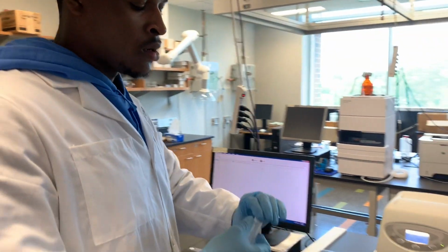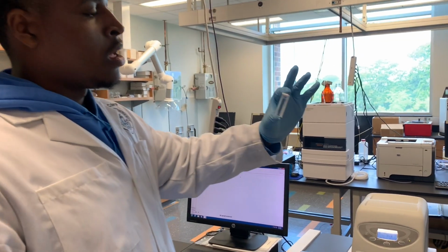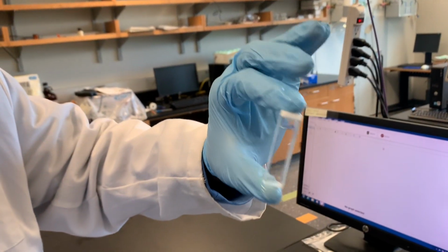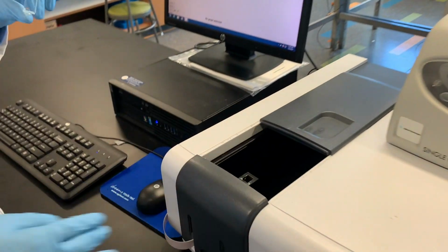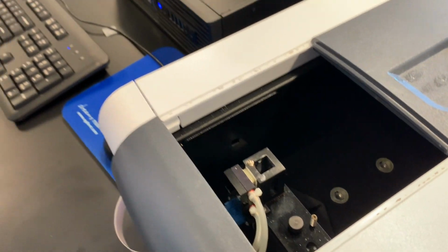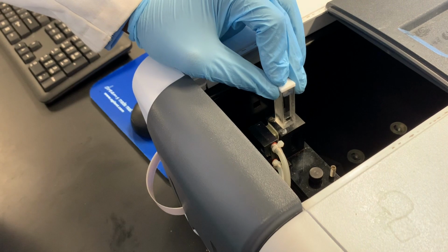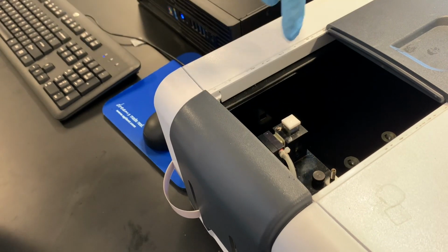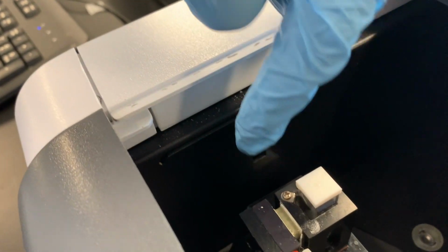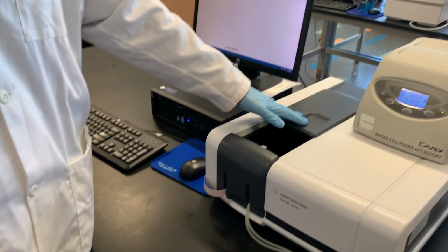So once you place the water in your cuvette, now you have to identify the cuvette you're using. I'm using a frosted side cuvette, which is compatible with the UV-Vis. Now when you place your sample into the UV-Vis, since the cuvette is frosted sided, you want to make sure the clear sides go in horizontally and the frosted sides are vertical. This is because the light comes in through here, and so you just want to make sure that it's not covered up by the frosted sides. Now you want to close the UV-Vis and set up your parameters.